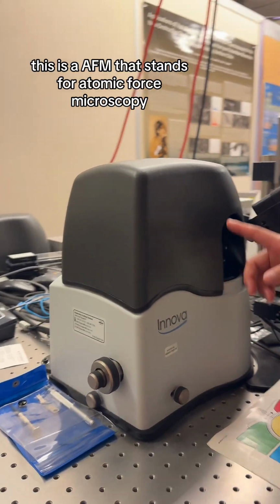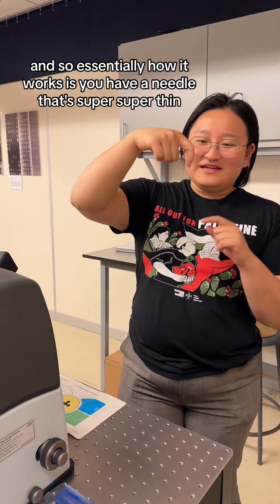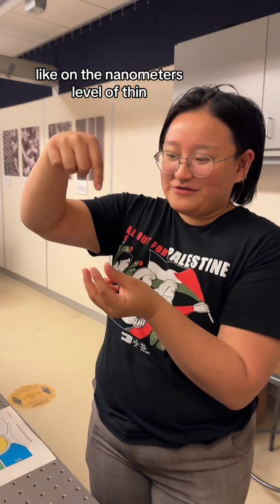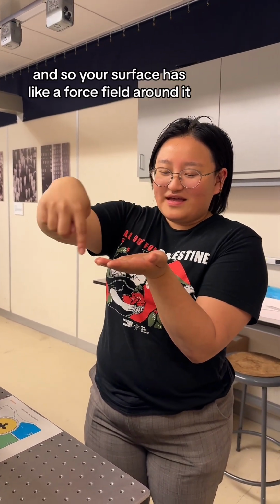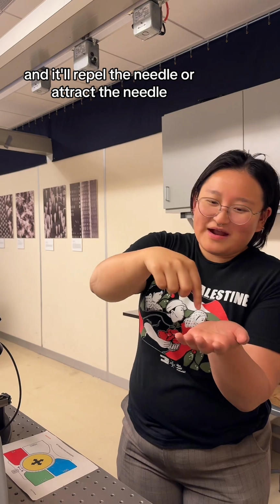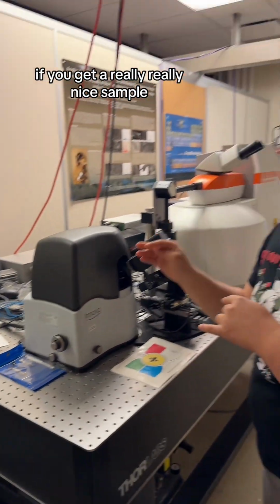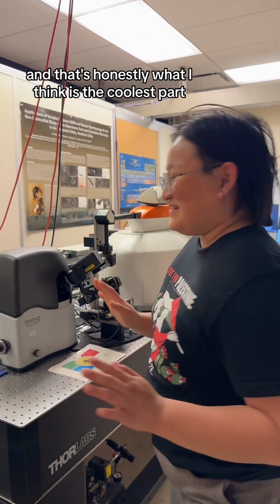This is an AFM, which stands for atomic force microscopy. Essentially how it works is you have a needle that's super thin, on the nanometer level, and you drag it across the surface. Your surface has a force field around it, and it'll repel or attract the needle, and from that you can get a resolution. If you get a really nice sample, it is possible to see individual atoms, and that's honestly what I think is the coolest part.